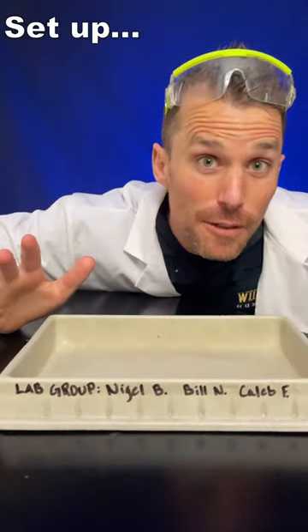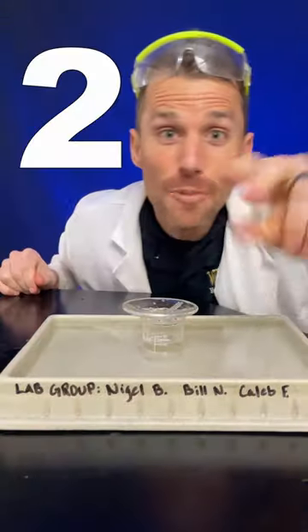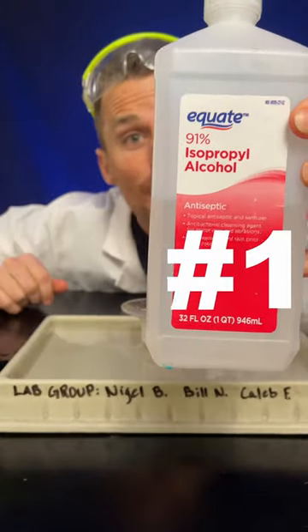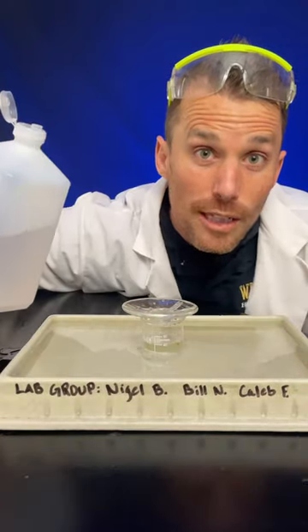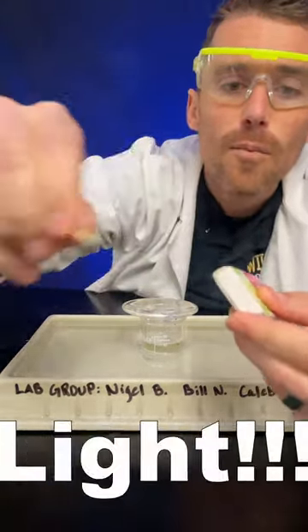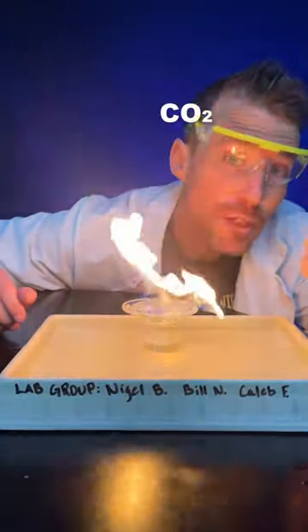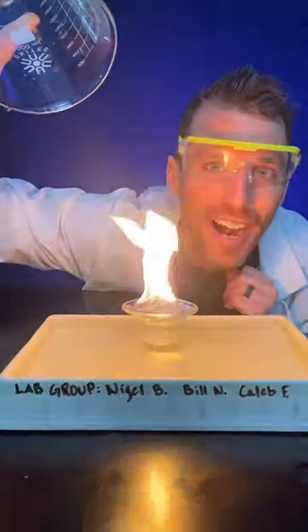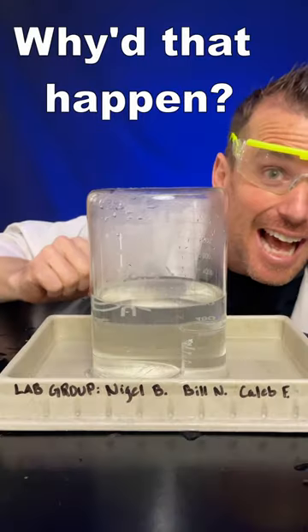Get a dish and fill it with water. Get a little beaker, fill with water, set in a tray. Get a watch glass. I've always used 91% isopropyl alcohol — I'm also going to try steel wool. Light the alcohol. The fire warms the air, produces carbon dioxide gas and hot H₂O steam. Get a big beaker and cover your fire.